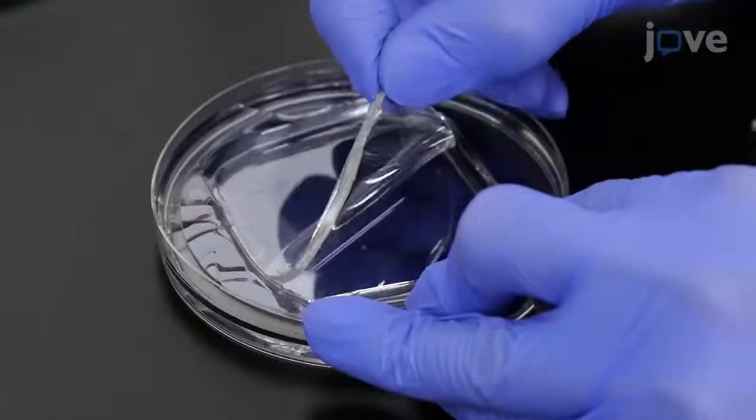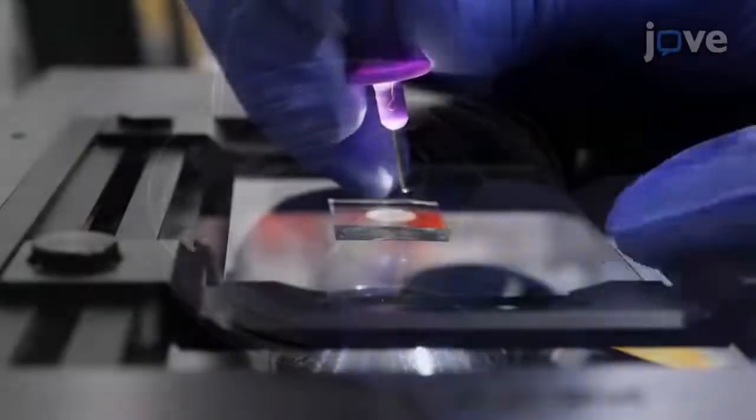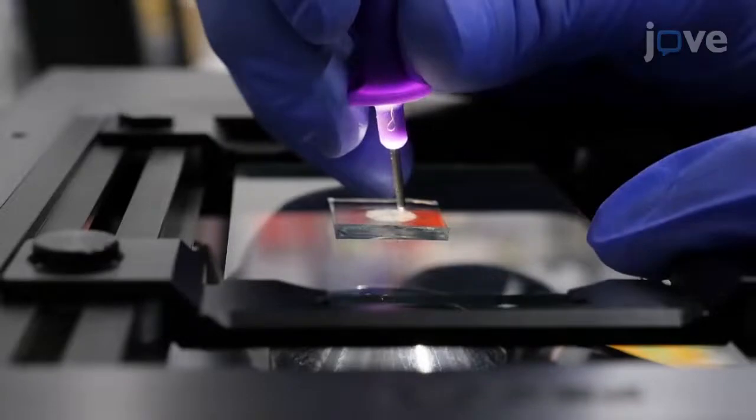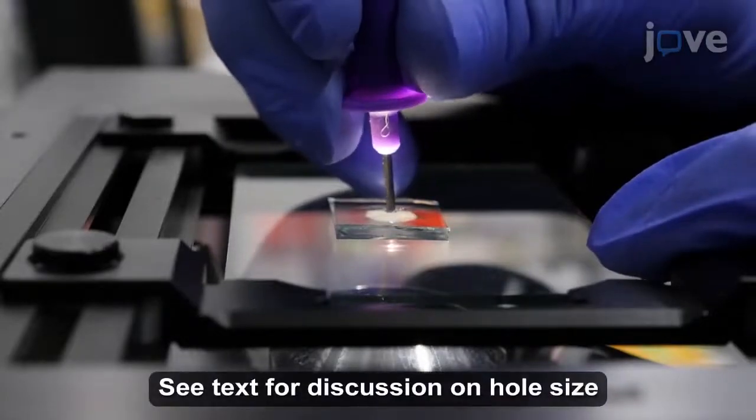Once cured, peel off the PDMS layer from the mold and open the access holes to the channel within the PDMS using a biopsy punch tool.